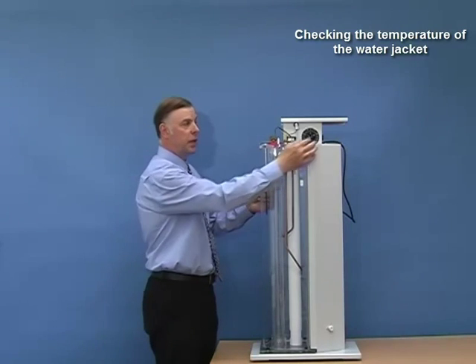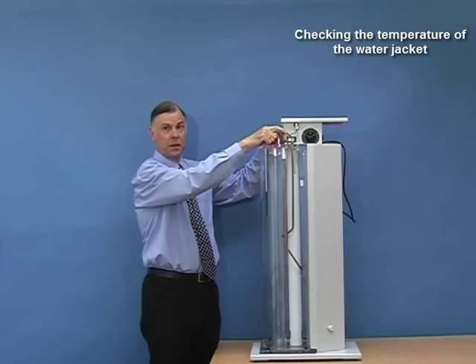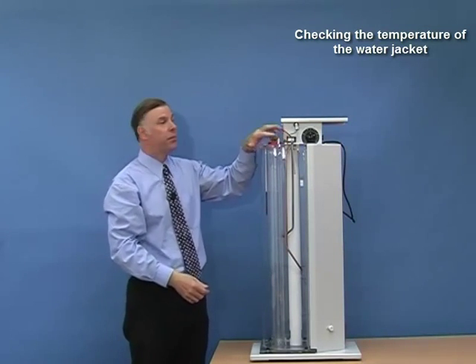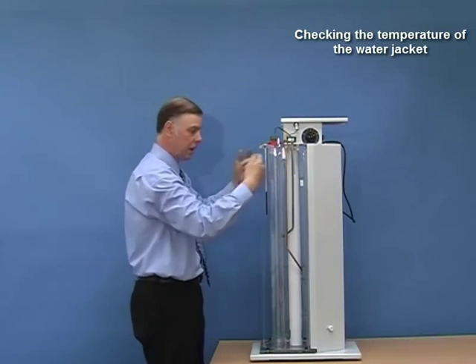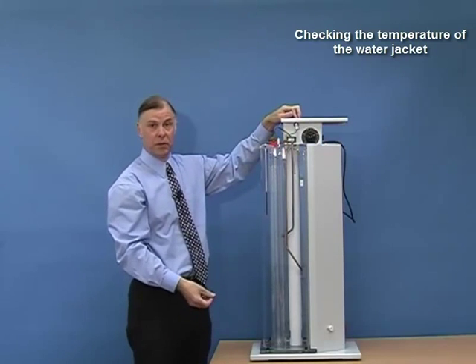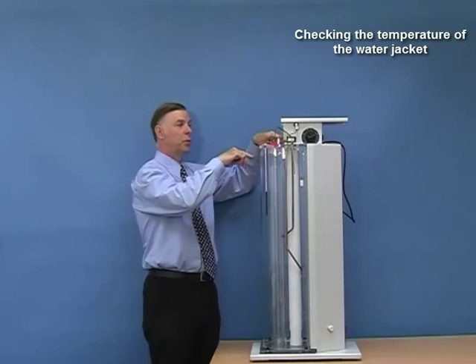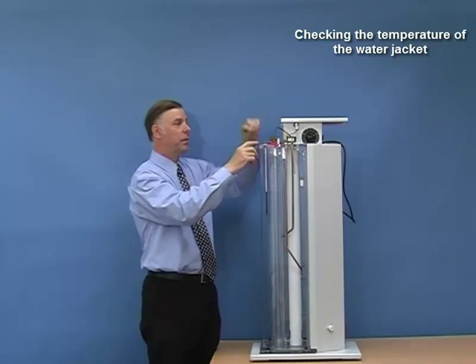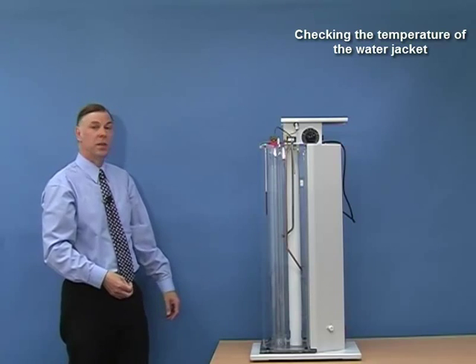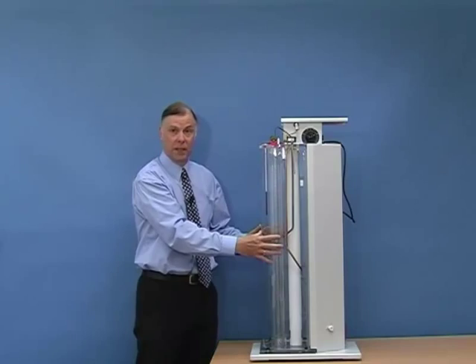The thermal control consists of two parts: an electrical heater controlled by a rheostat, and water cooling through these tubes. If the room temperature is well below 23 degrees — for example 19 degrees — it is likely that water cooling is not required. All we would do is adjust this potentiometer, allow time to stabilize, and then measure the temperature. Each division on the potentiometer is approximately 0.2 degrees centigrade. If the room temperature is close to or even above 23 degrees centigrade, then we need some kind of cooling effect — connect mains water into the inlet tube and the outlet tube to a drain, just a gentle flow of cooling water to help maintain the temperature. If the laboratory temperature is very much higher, then you will need a chiller system, but that must be specified at the time of order because the mechanics inside will be slightly different.